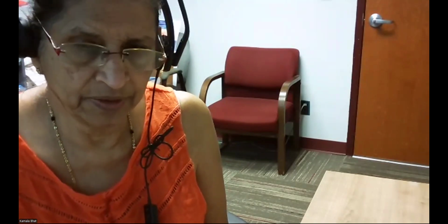Welcome. This is lab number 2 for General Chemistry 101. The title of the experiment is Caffeine Extraction. We're going to extract caffeine from Mountain Dew. Extraction is a separation technique based on physical properties. Therefore, the compound itself does not change during the extraction process.